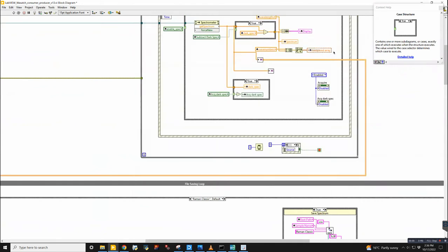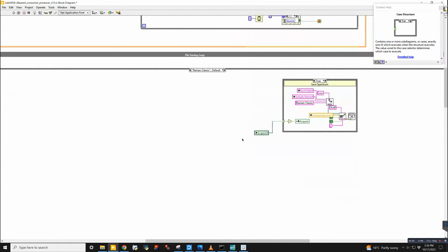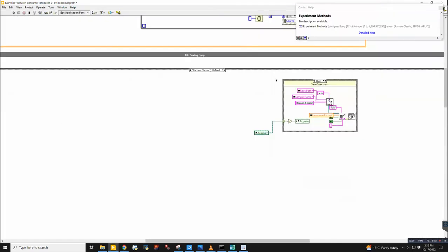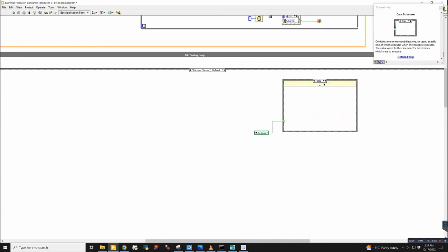This is the transposed array. Every spectrum that comes in is this transposed array, and this loop basically waits for you to click acquire. It will be in this Raman classic case if you have it clicked over here. As soon as you click acquire, it will come in here. It'll take that transposed array and write it to a spreadsheet with all these naming properties. And if it's false, then it does nothing. So this will just loop indefinitely, waiting for you to save a file.